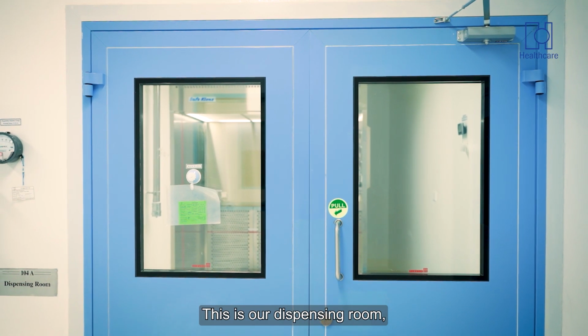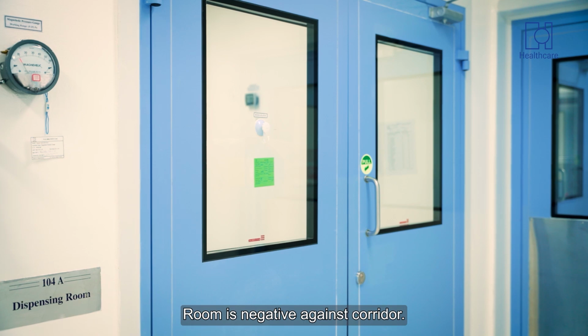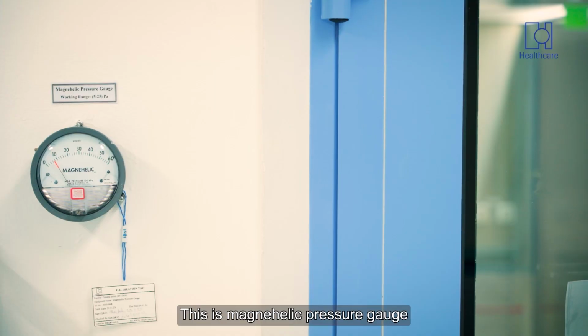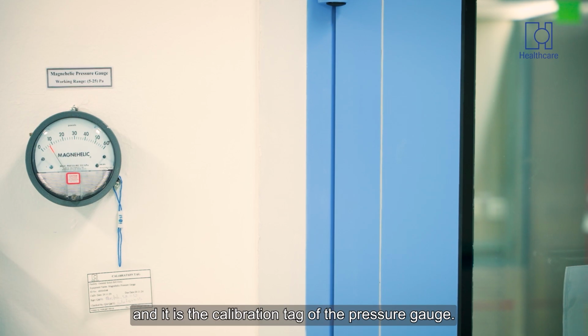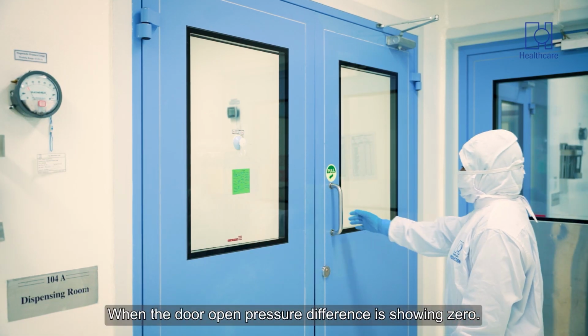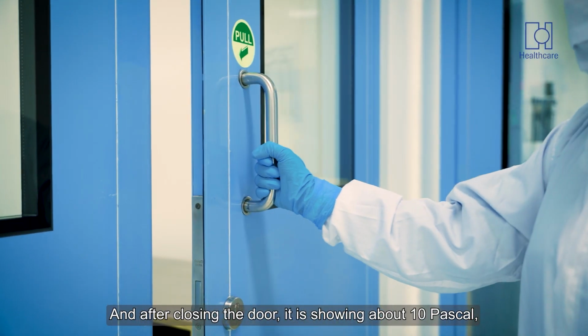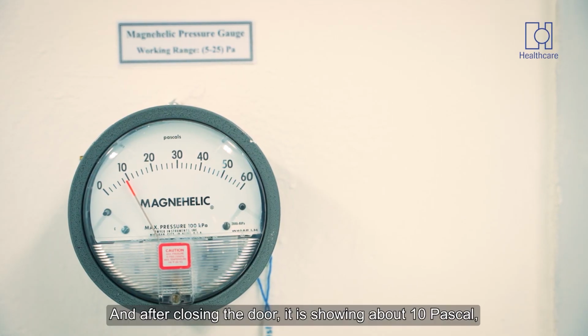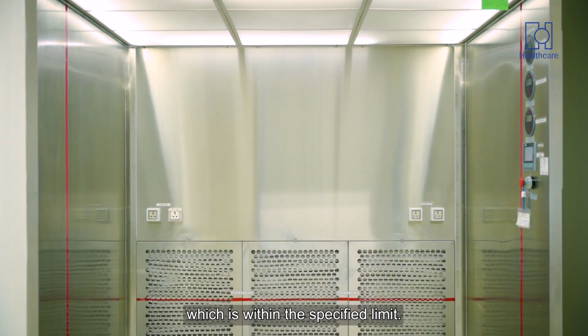This is our dispensing room. Pressure difference is maintained between room and corridor. Room is negative against corridor. This is the Magnehelic pressure gauge and this is the calibration tag of the pressure gauge. When the door opens, pressure difference is showing 0, and after closing the door, it is showing about 10 Pascal, which is within the specified limit.